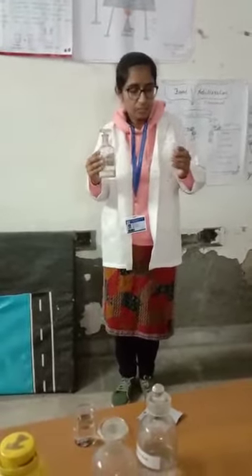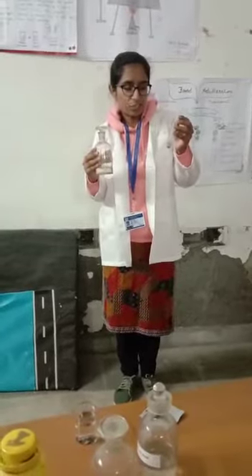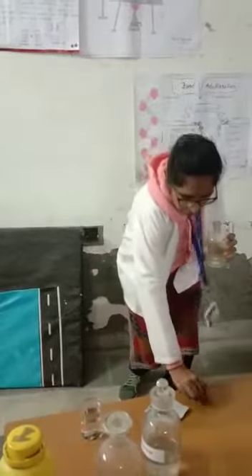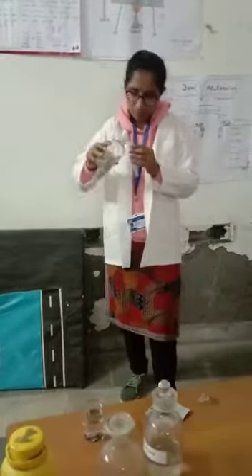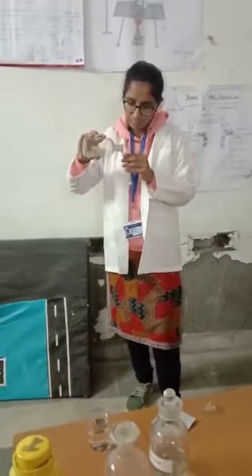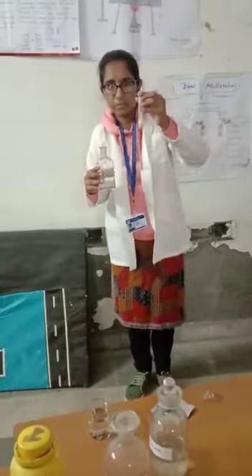Now we do the confirmatory test for SO4 2- ions. We take CaSO4 in our test tube and then add lead acetate. This gives a white precipitate, so SO4 2- ions are confirmed.